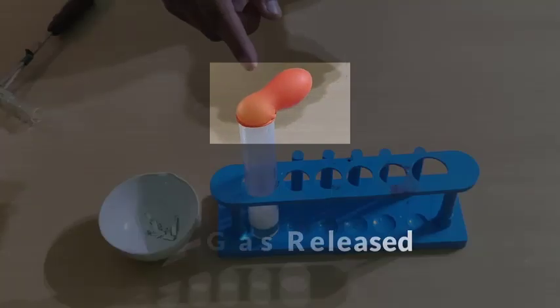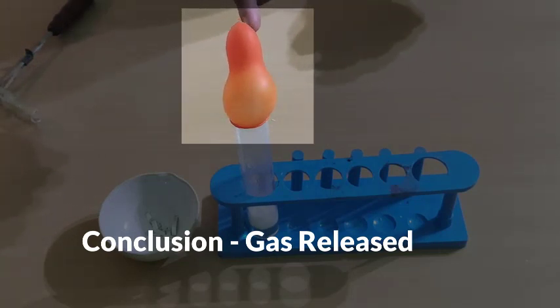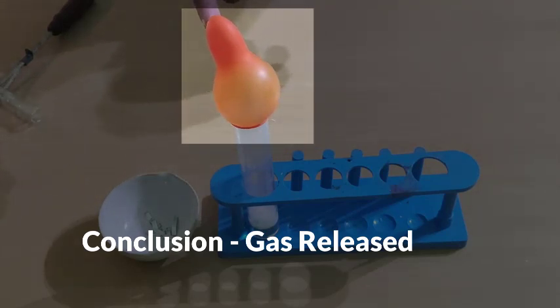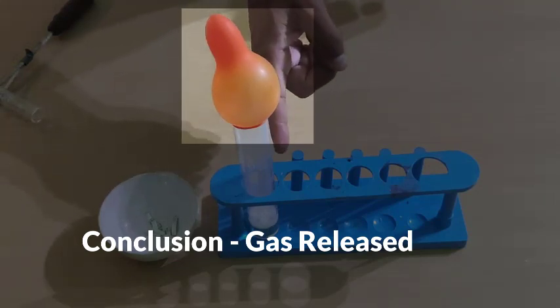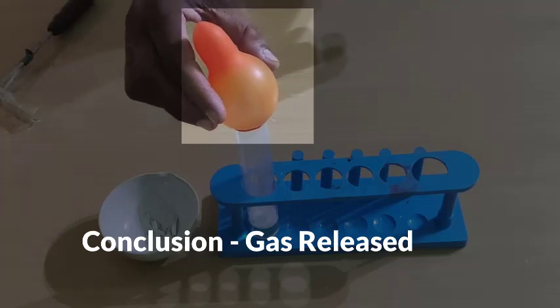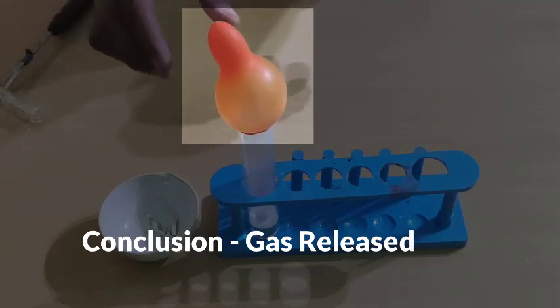Now see, the balloon is getting inflated, which means some gas is coming out and it is getting collected in this balloon. And see, it's interesting that without blowing a balloon, it is getting inflated. See, a large quantity of bubbles are being formed at the bottom of this test tube, and see a round shaped balloon, very nice to see.